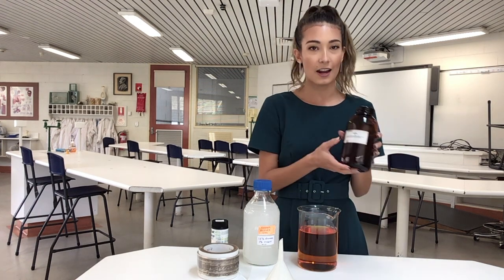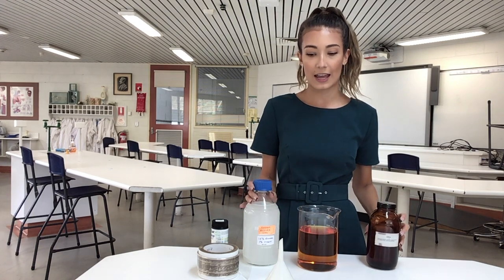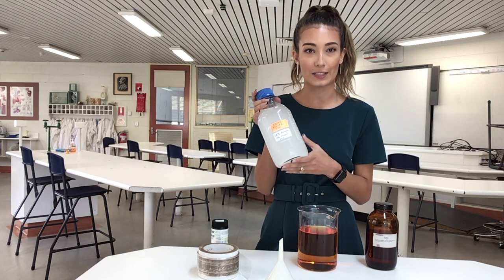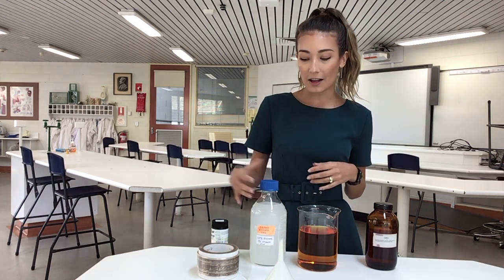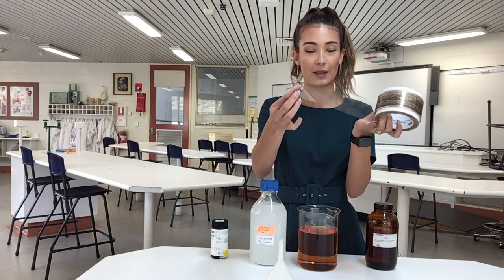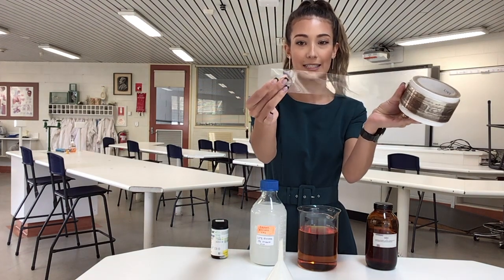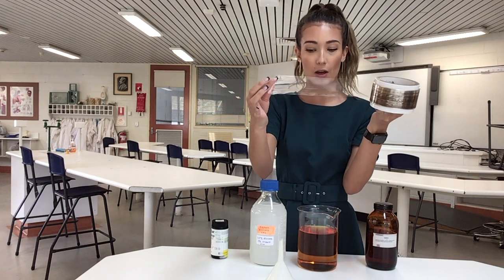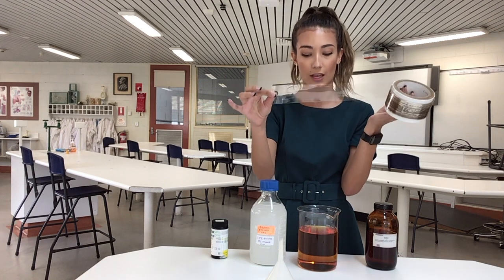We have a couple of different materials that we're going to start with. We have an iodine solution which we have diluted into the beaker with a bit of water, and then we have our solute solution which is a 15% glucose and 1% starch solution as well. Our example of a semi-permeable membrane is something that we call dialysis tubing, and it is this clear transparent plastic, essentially a plastic bag that we're going to be using as our semi-permeable membrane. So our solution is going to diffuse through this.